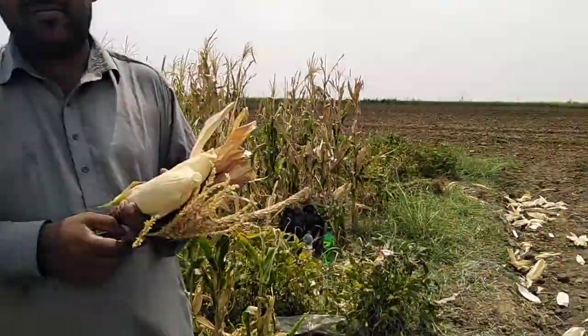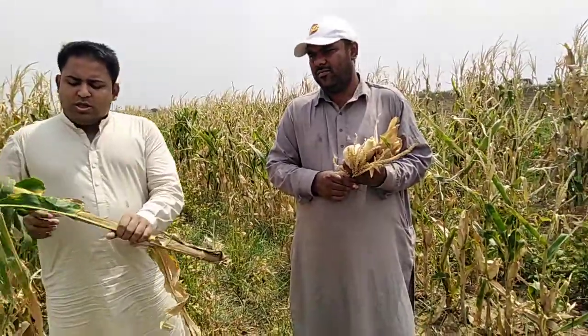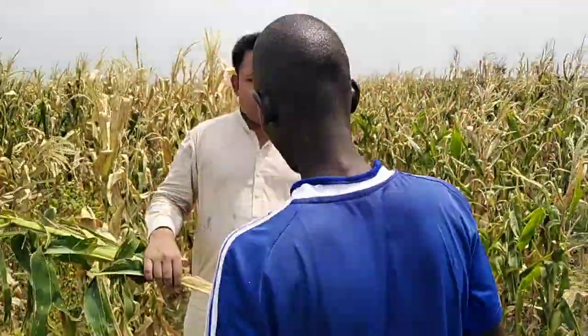So I think one question. I wanted to ask you about the stem. Now, after separating the leaves from the stem, do you need to... because you had told us that you will cut. Is this part not to be removed from the stem? No, you will dry it with the stem.